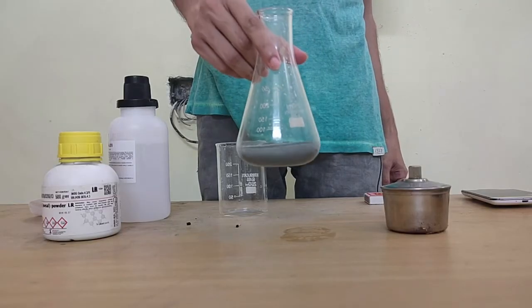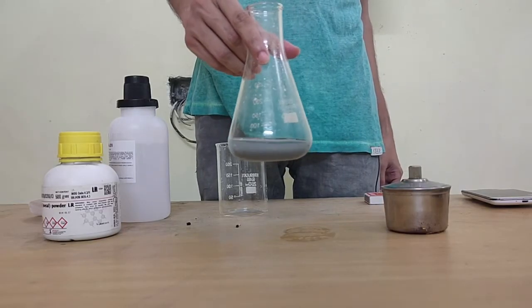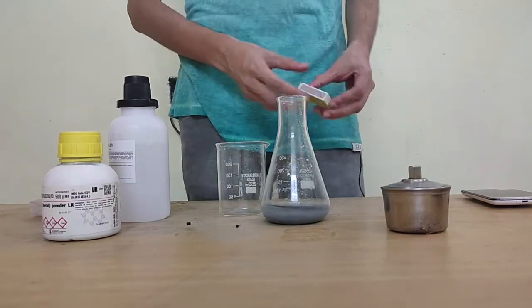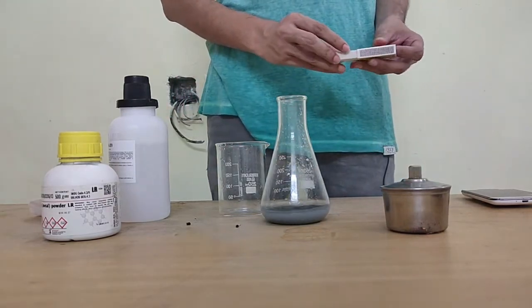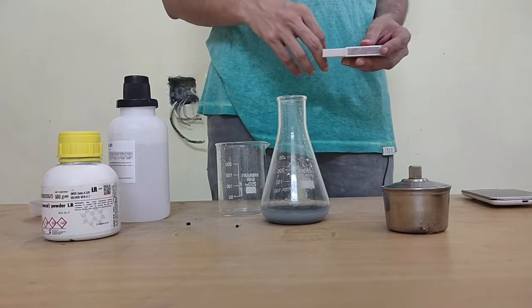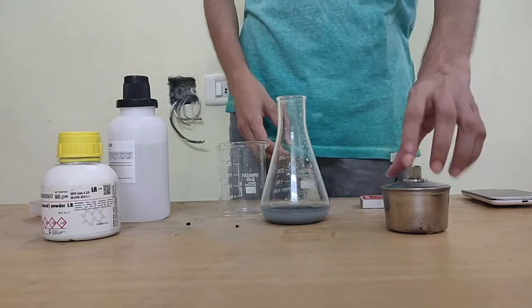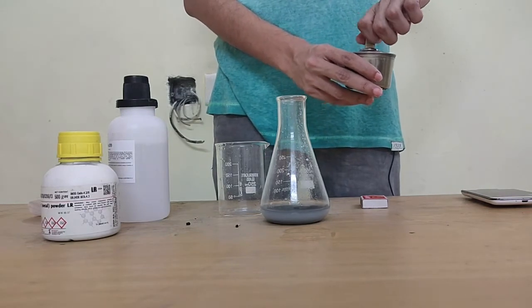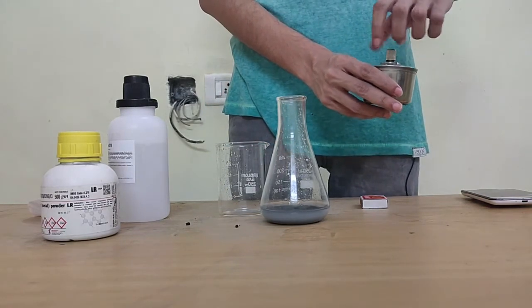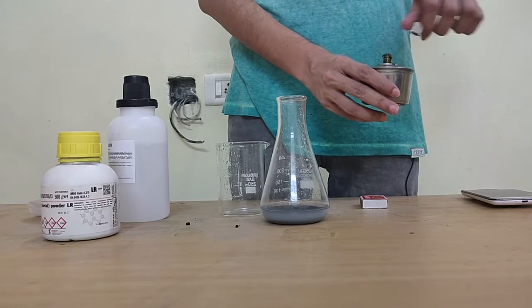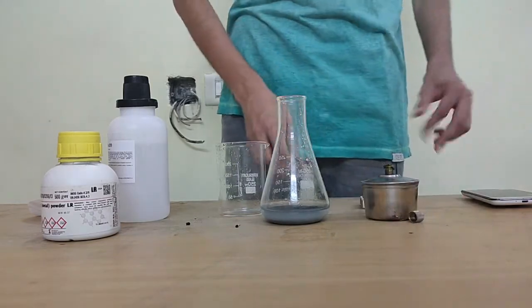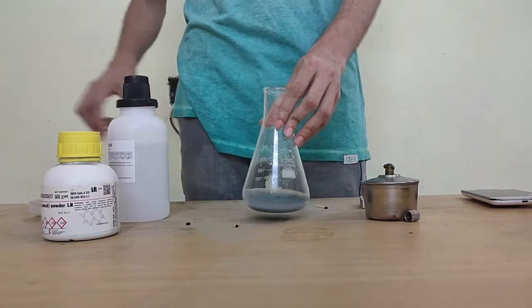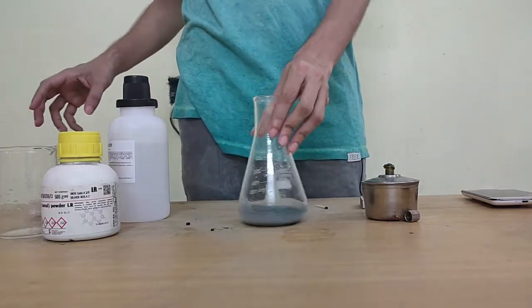Off the top you won't see any much of a visible reaction here, which is fine because this reaction doesn't happen normally. If you remember in the chapter chemical equations we read about something called endothermic reactions. These are reactions that need heat for them to occur. This reaction is one example of an endothermic reaction wherein I'm going to need to use a slight amount of heat for the reaction to occur, which is why I need this spirit lamp with me.